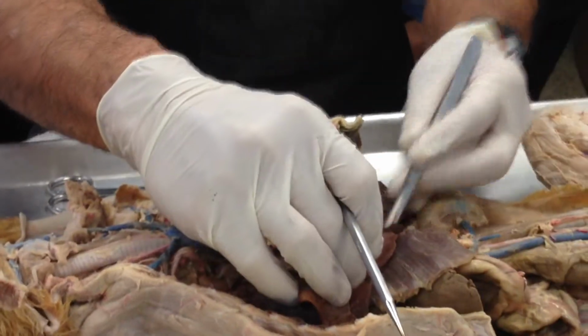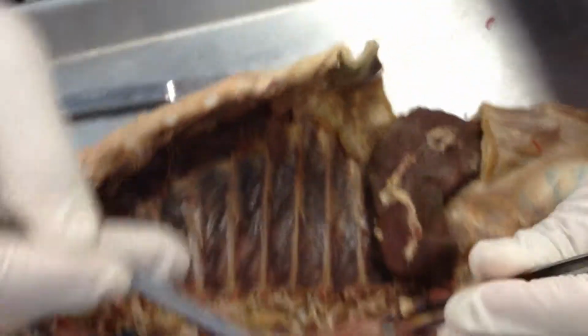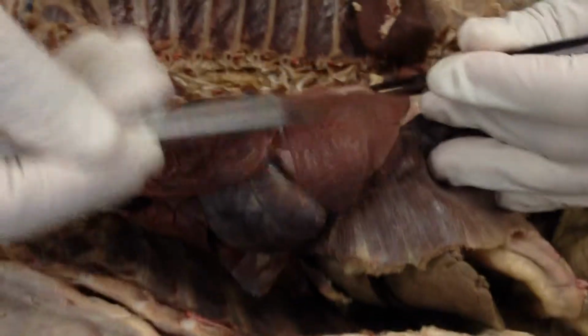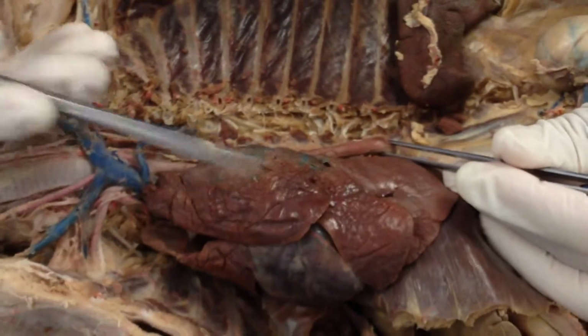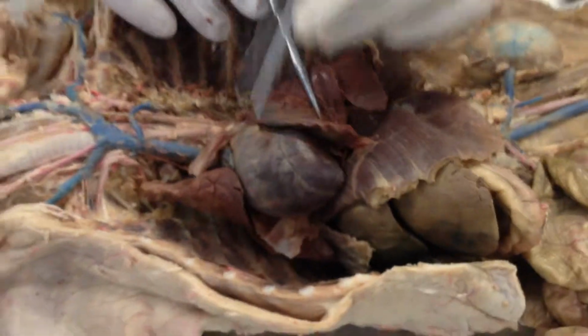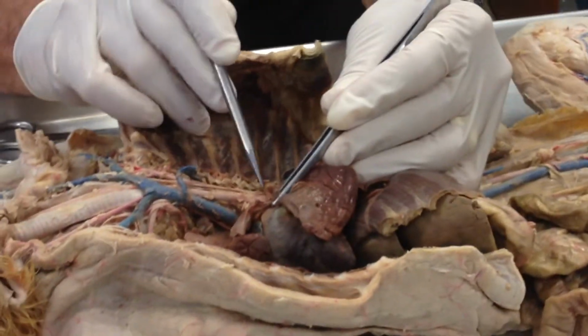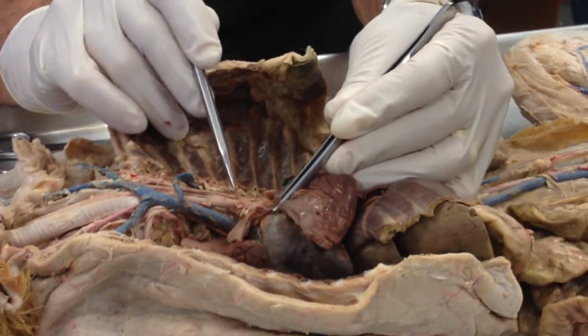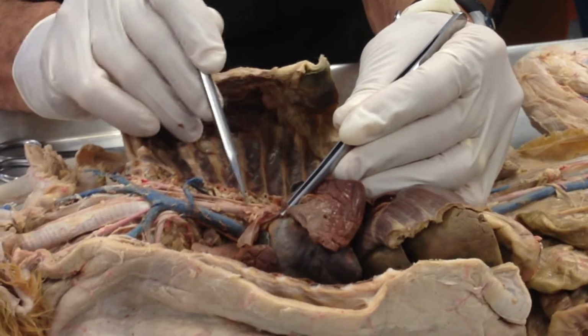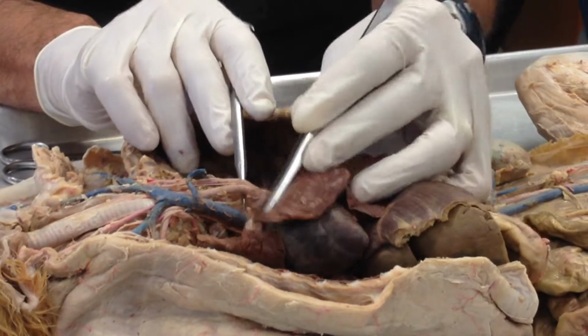is the big artery of the body, the aorta. So we can see the aorta now, notice on the right hand side. So we flip the organs over, the heart and lungs over to the left, and there's my aorta on the right. So now we work towards the heart, and there we see the aortic arch, the curvature, and on the aortic arch are two arteries or two branches right there.